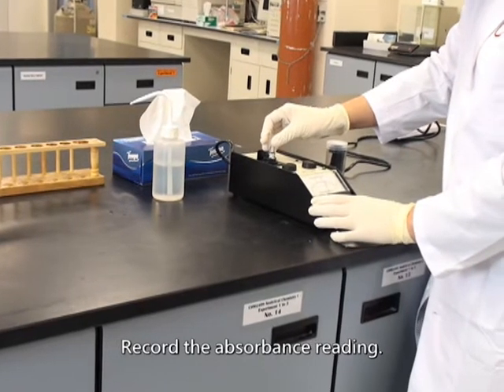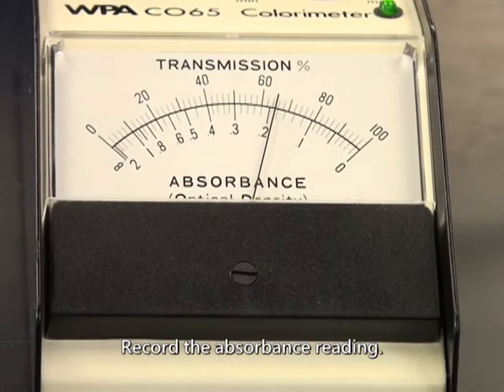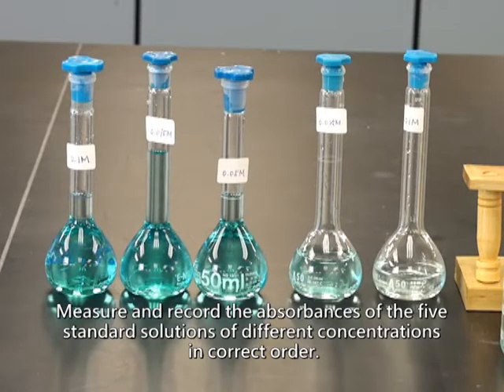Record the absorbance reading. Measure and record the absorbances of the 5 standard solutions of different concentrations in correct order.